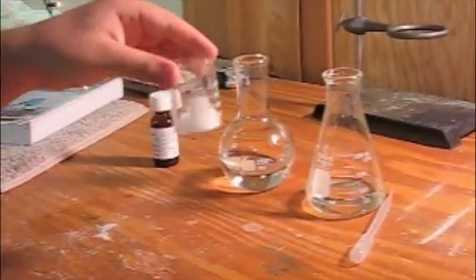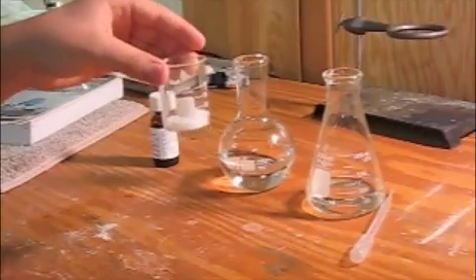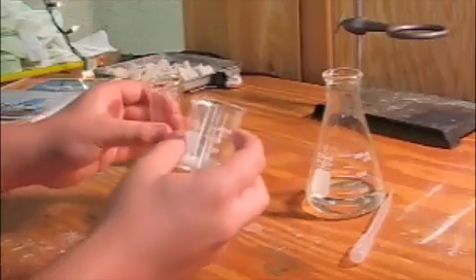In this video, I will be performing a synthesis of an iodine solution.